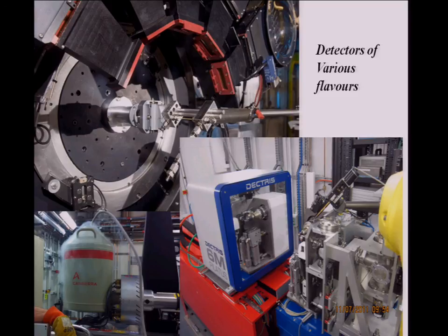So this, in the bottom right, is a Pilatus detector, which is a CCD, which I believe is similar to a digital camera, but it's just a lot bigger. It's just a great big silicon chip. This, in the bottom left here, I haven't got a pointer, but you see this big cooling nitrogen tank, and attached to it is a bunch of germanium elements, and that's used in a spectroscopy experiment. It's got a 64-element array, and so is the one at the top.